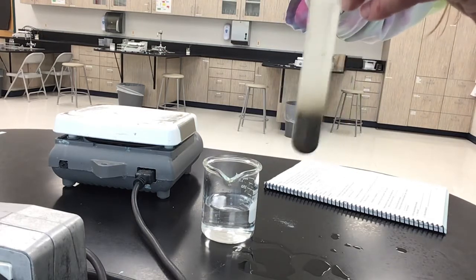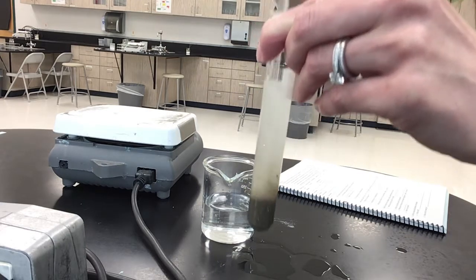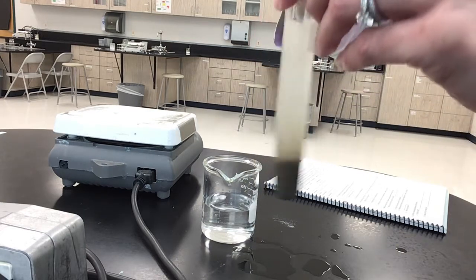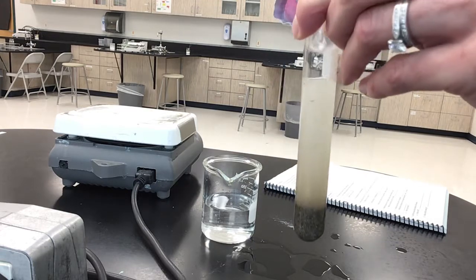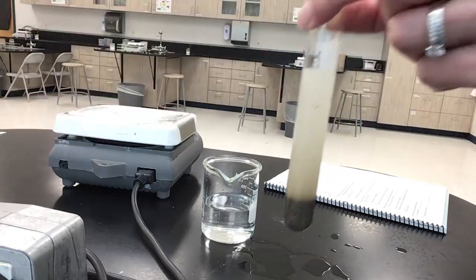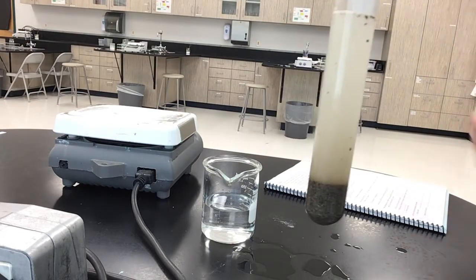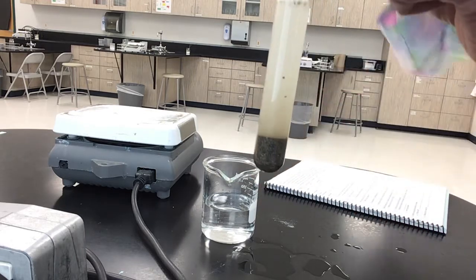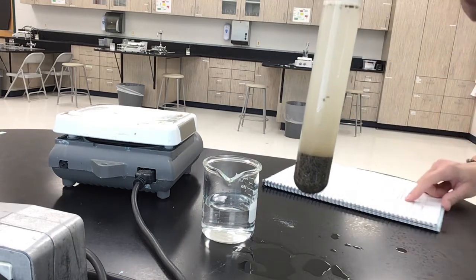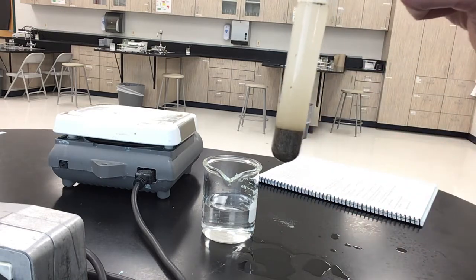Okay, so then it's asking you what you're seeing. So the sand really isn't going away. Okay, so you can answer the questions for number 3. What do you observe? Is it homogeneous or heterogeneous? I can see two different parts here, definitely heterogeneous. What type of mixture? If it's settling out, I know I have a suspension.